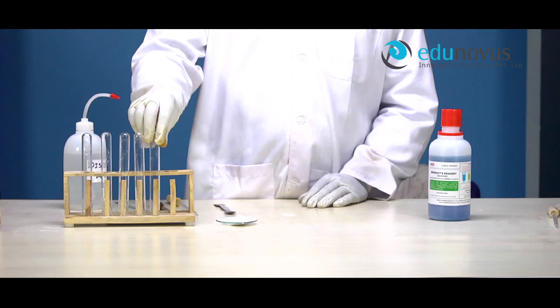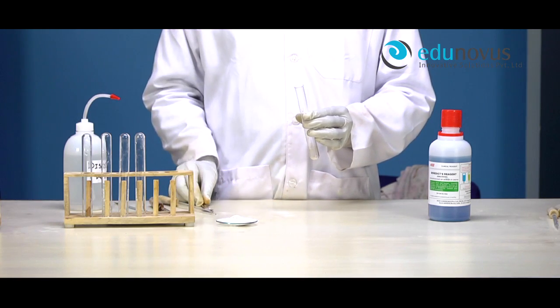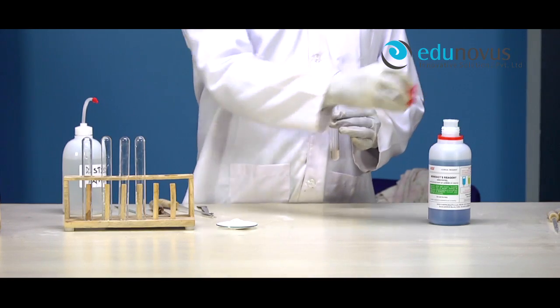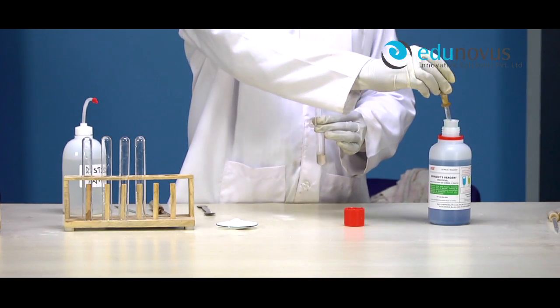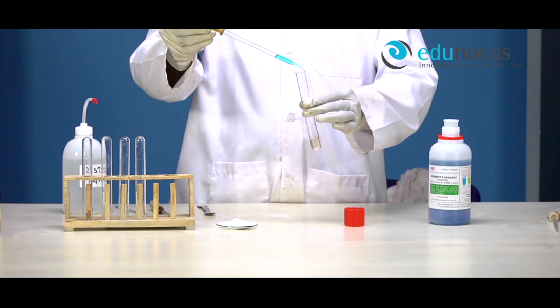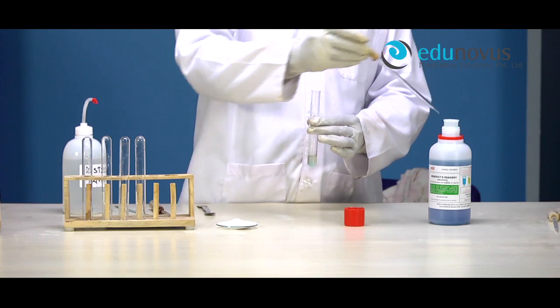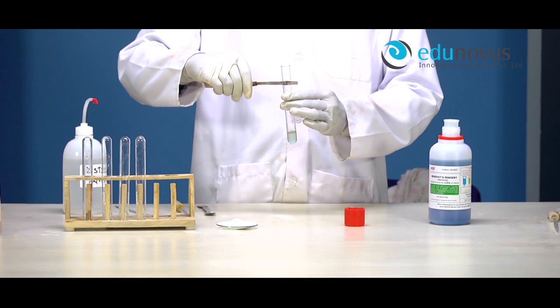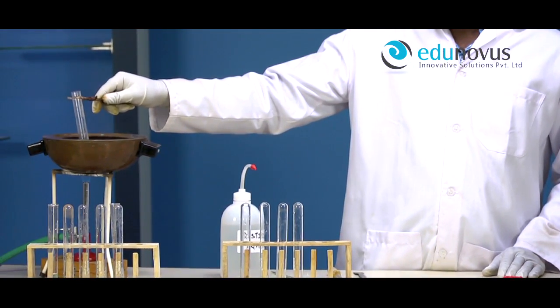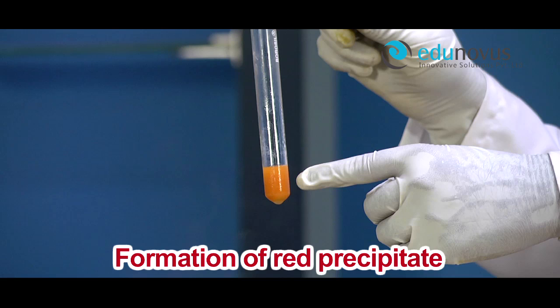Benedict's Test. To the aqueous solution of the food compound, add few drops of Benedict's reagent and heat it on a water bath. Formation of red precipitate of copper oxide indicates the presence of carbohydrates in the given food compound.